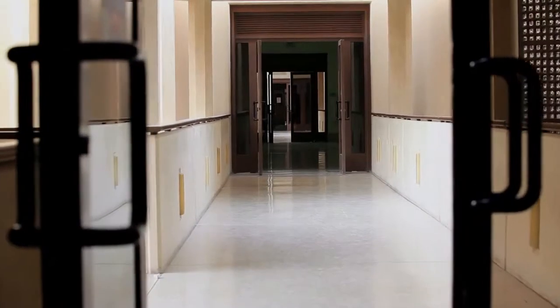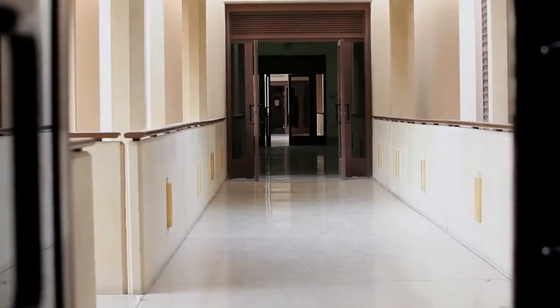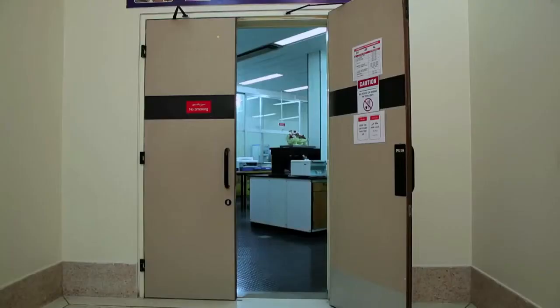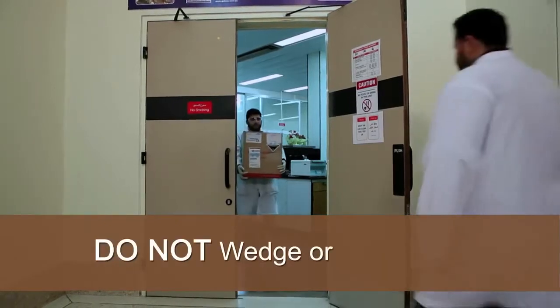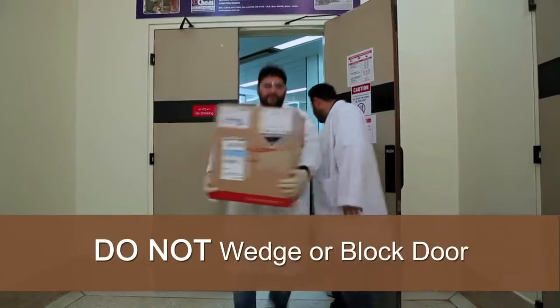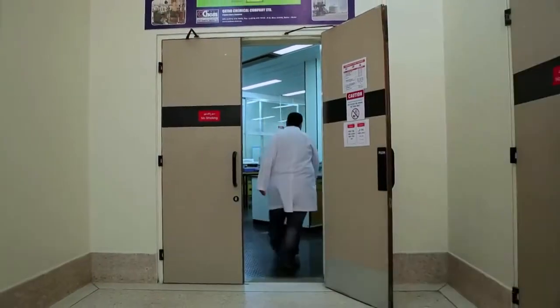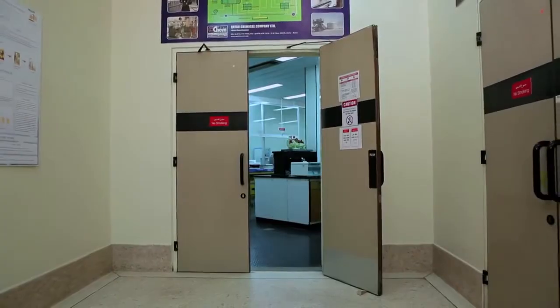Fire and life safety preparedness extends outside the lab. The corridors and office spaces surrounding your lab are vital links allowing evacuation in an emergency. In the event of a fire, wedging or blocking doors open permits toxic smoke and gases to migrate from the fire area into the exit corridor, making it difficult or impossible for occupants to exit safely.